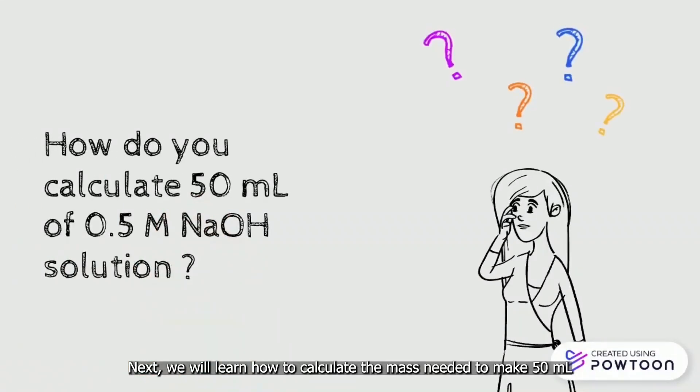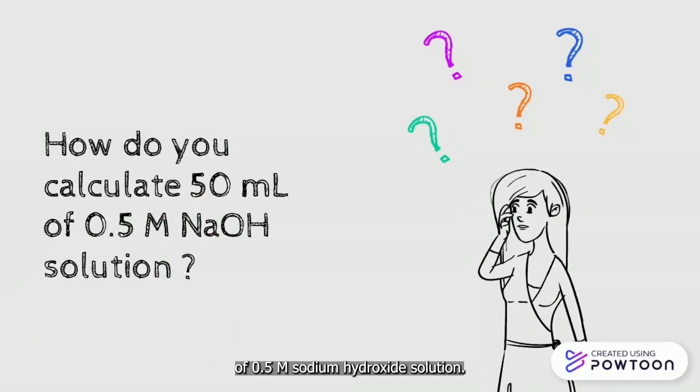We will learn how to calculate the mass needed to make 50 mL of 0.5 molar sodium hydroxide solution.